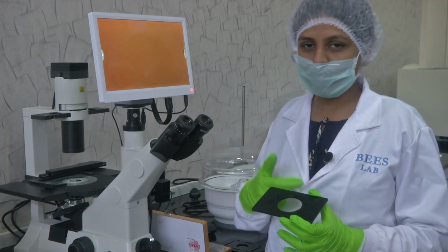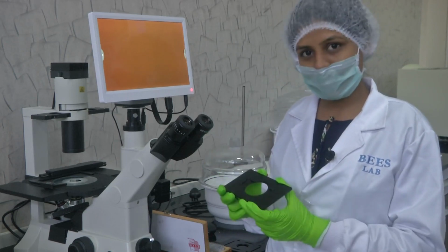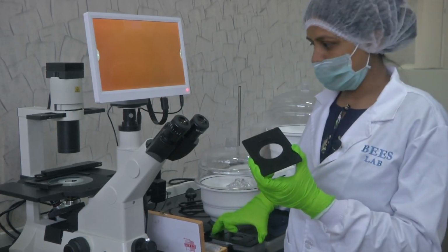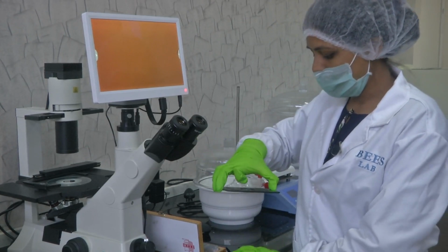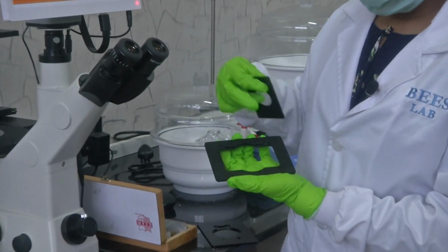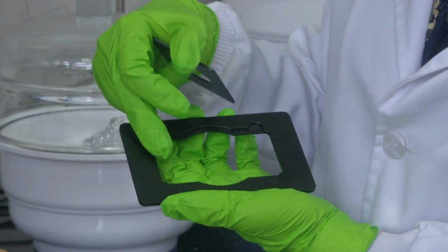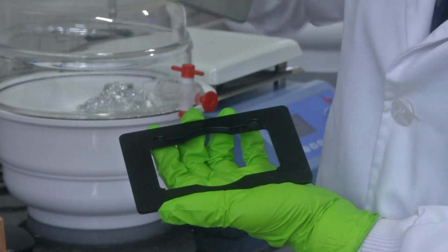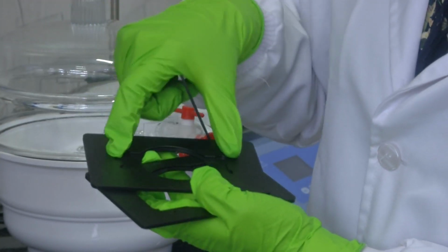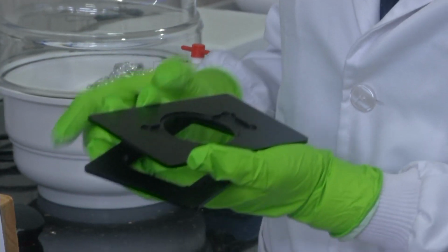All of this has been covered in the regular course by the professor, and now let us see how we could practically use the glass slides and study them under the microscope. Along with this stage adapter, there is another one where you could place your petri dish. It has a larger area. It could be a 100 mm petri dish, or a 35 mm petri dish, and you could use this for proper housing of your dish or slide and fix them on the stage.